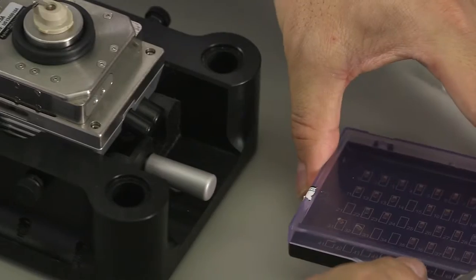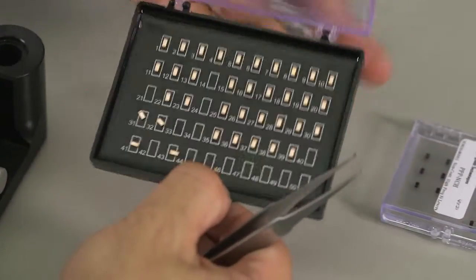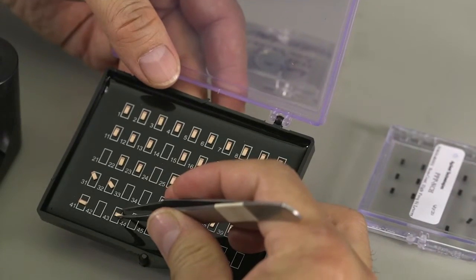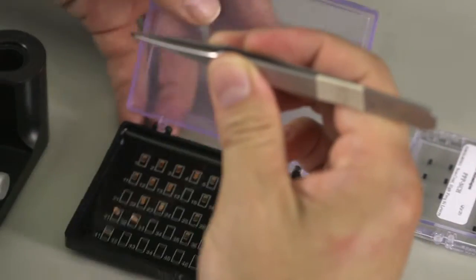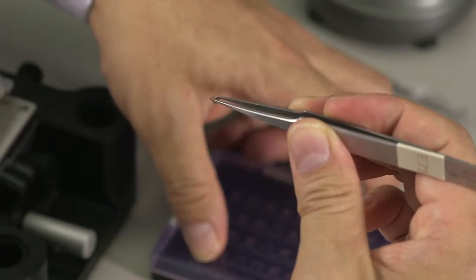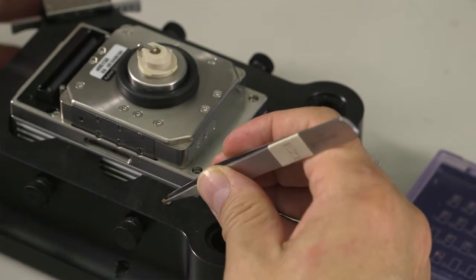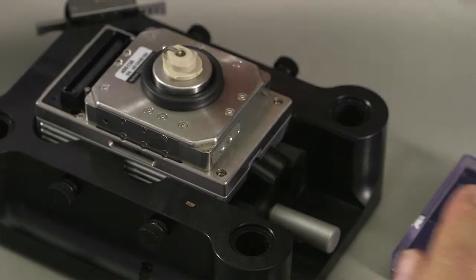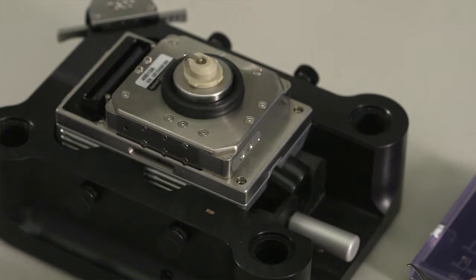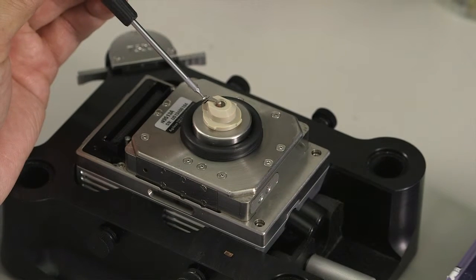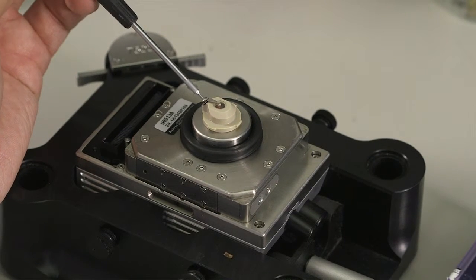Now let's pick up a cantilever from its box. First, you set the cantilever on the surface. And then you pick up your screwdriver and adjust the screw that tightens the spring.